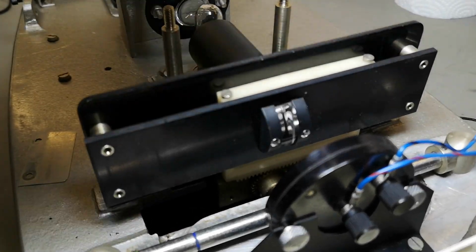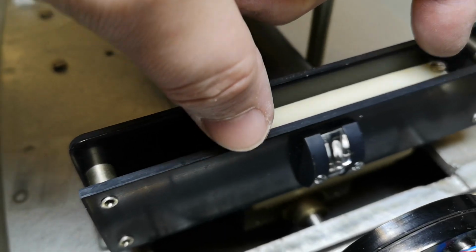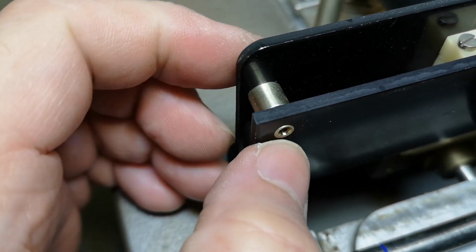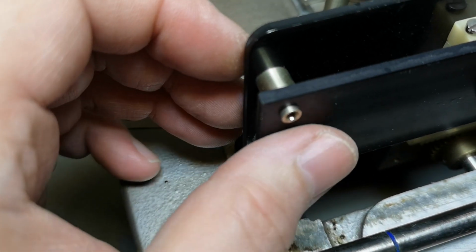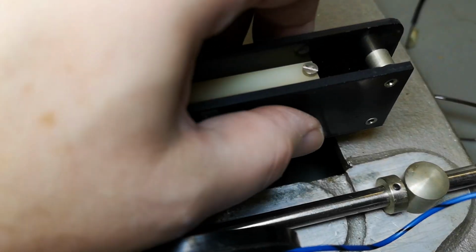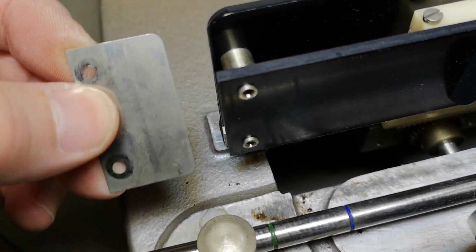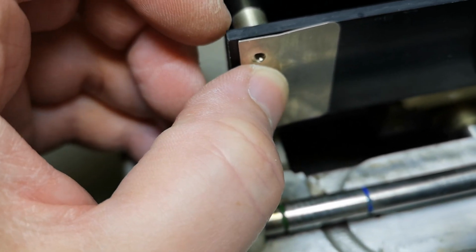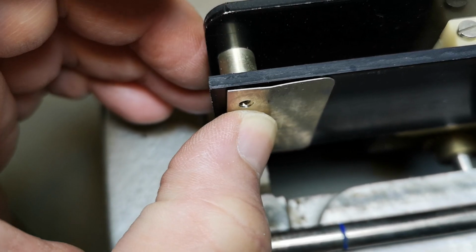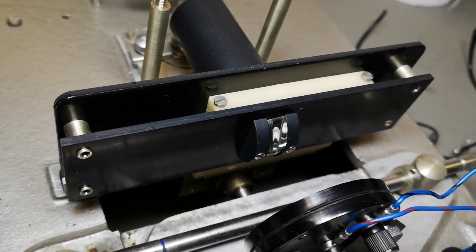So this is how the mounting works for this front plate. So it's not going to press too much or too little. You don't want any false light to go in here or anything like that. So this unit here is, as you can see, it can move a little bit, and if I push too much here, it will go out in the other side. If I push in the middle, see? So to get the right tension on this plate, this is actually a spring device. So when you screw this in here, it's going to push on that plate with exactly the right force. See, this is a spring thing. They thought about everything. Small little cool details.